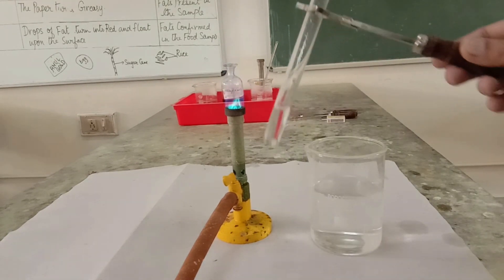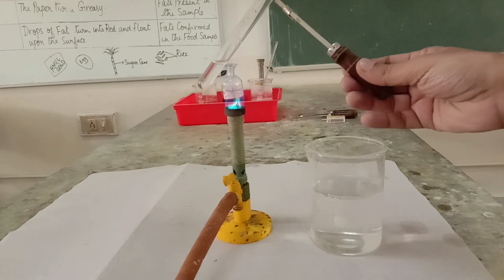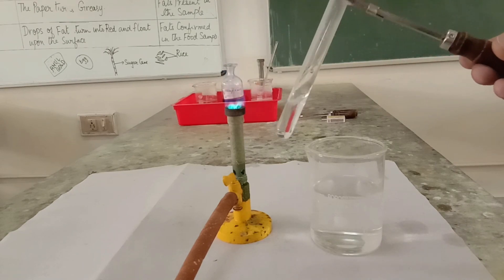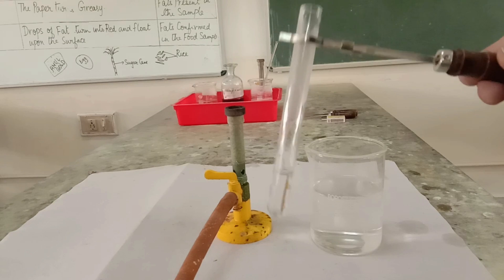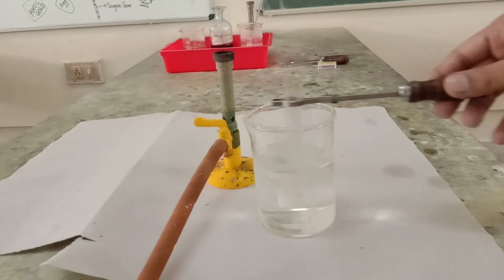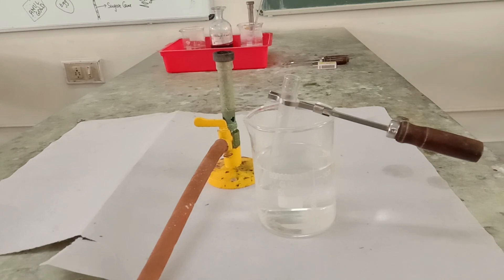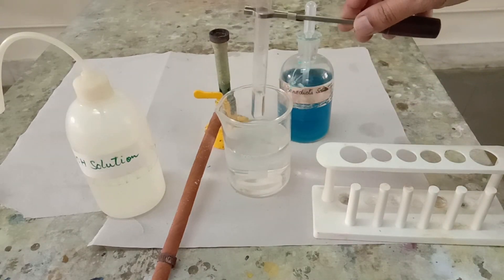Now I am going to heat the mixture over the Bunsen burner for about 10 seconds. Now I am going to put the test tube into the water bath and allow the mixture to cool for about 30 to 40 seconds. After about 30 seconds, the mixture is almost cooled.